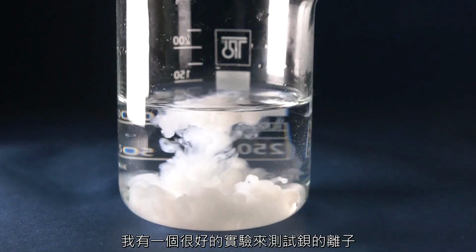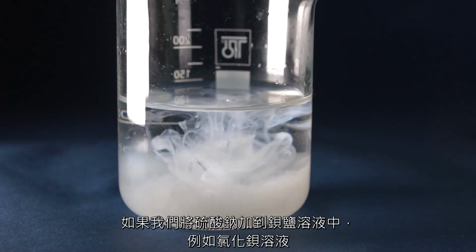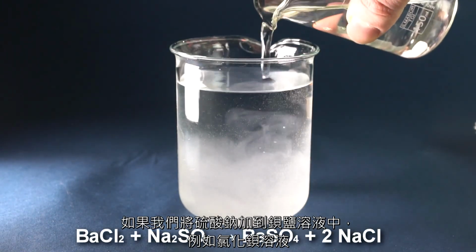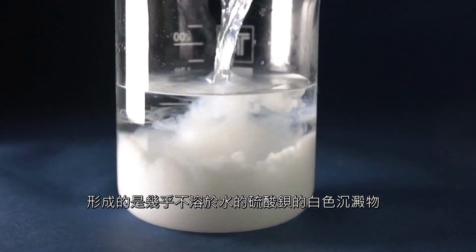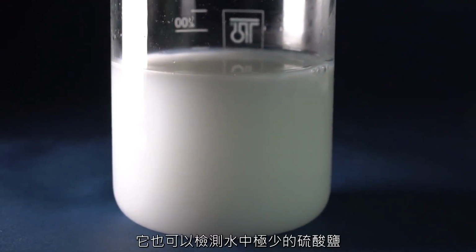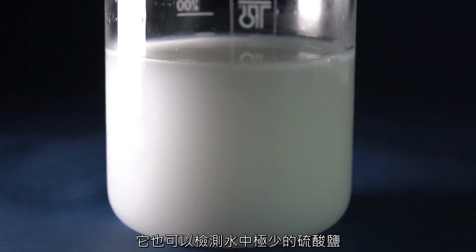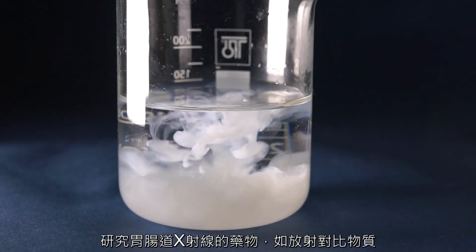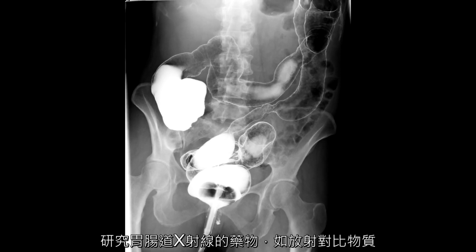For ions of barium, there is a very good qualitative experiment we can do. If to the solution of a salt of barium, such as barium chloride, we add some sodium sulfate, then what will form is the almost insoluble in water white precipitate of barium sulfate. This reaction is very sensitive, and it can be a very helping hand in detecting even small concentrations of sulfate in water. By the way, barium sulfate is used in medicine for X-ray studies of the gastrointestinal tract, as a radiocontrast substance.